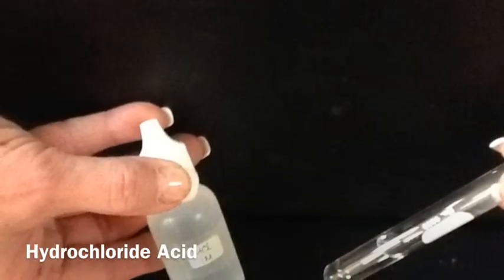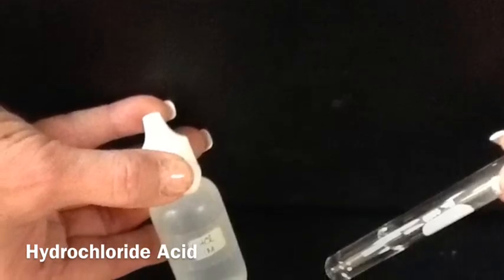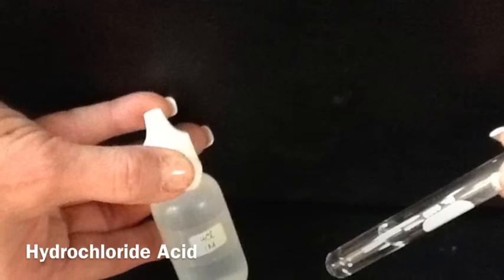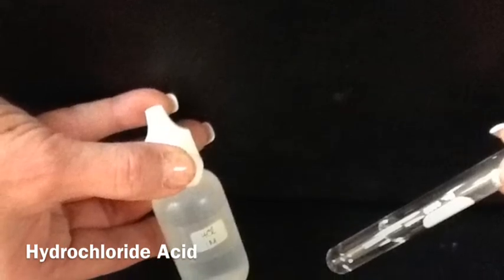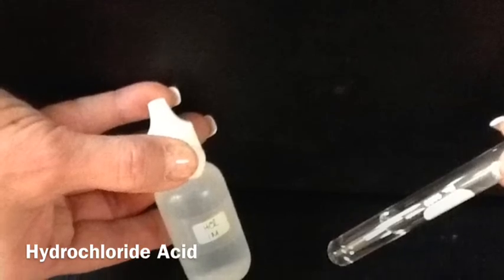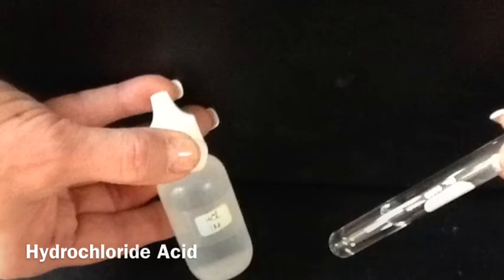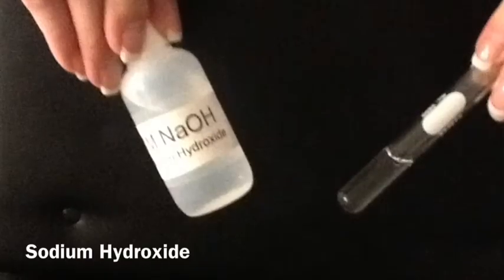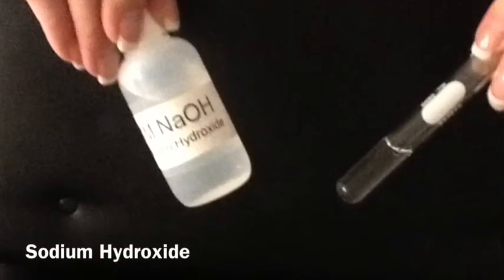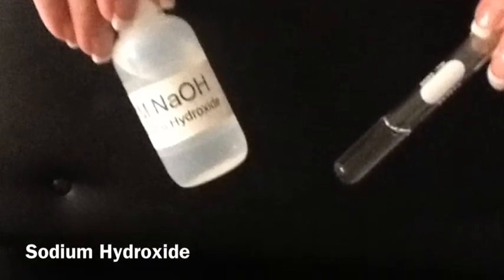The next chemical is hydrochloric acid, HCl. When you're describing the color, notice that it has no color, so you will say colorless. Again, clear means that you can see through it or it's transparent. Colorless means no color. The third chemical is 1 molar sodium hydroxide, NaOH.